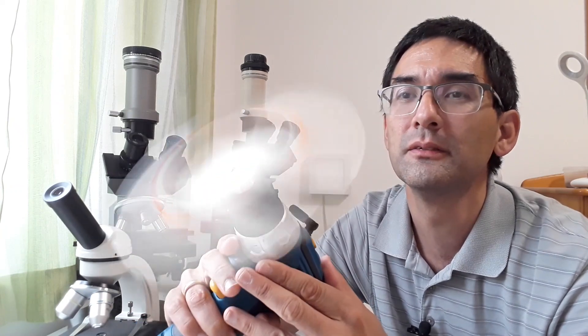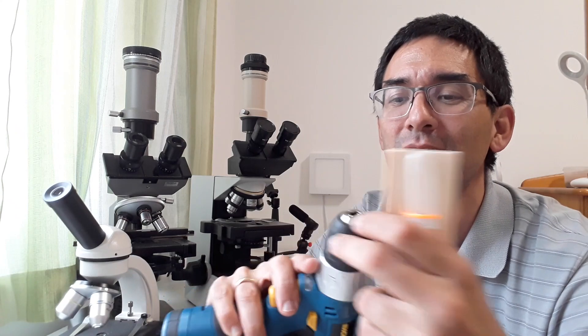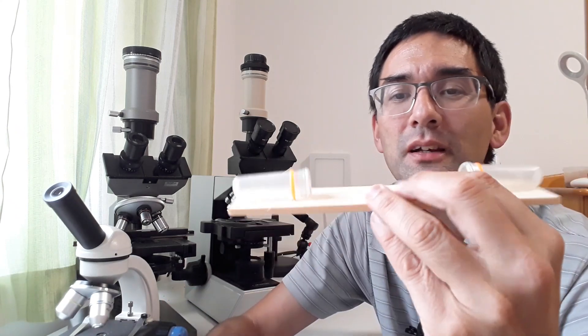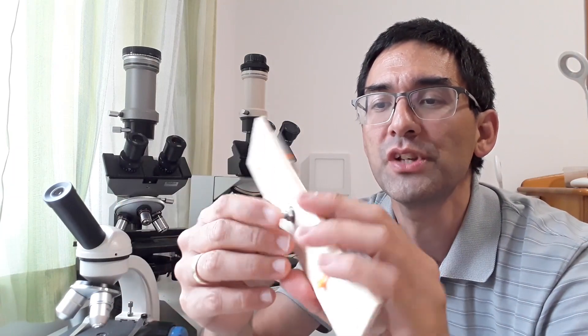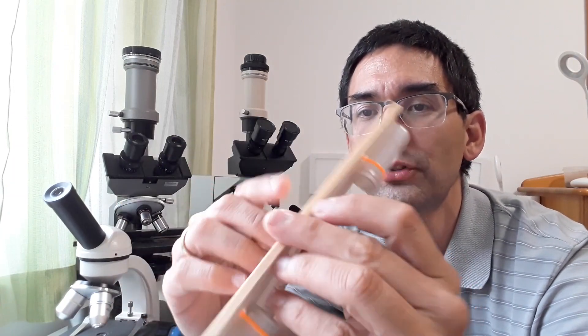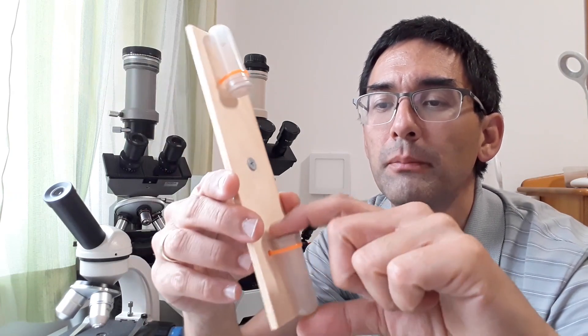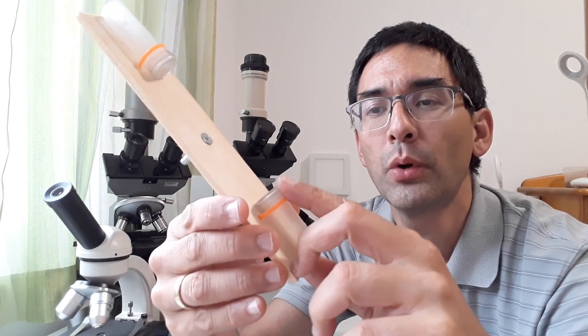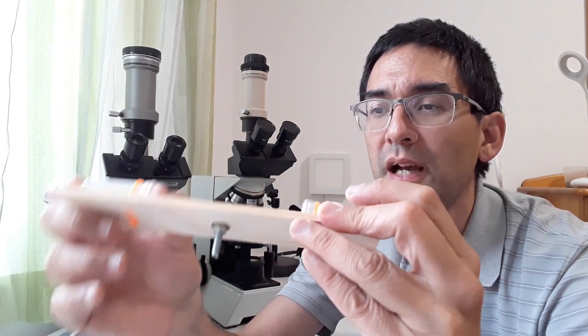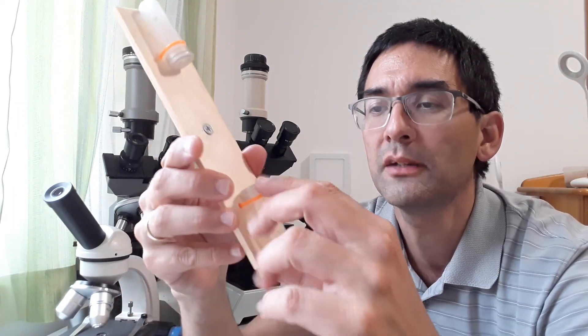What I've got here is an electric drill. It's a homemade centrifuge. It's a piece of wood with a screw in the center, and I have plastic tubes with a rubber cap on top. If you add a water sample here and an equal mass on the other side for balance, you can spin this for a couple of minutes.